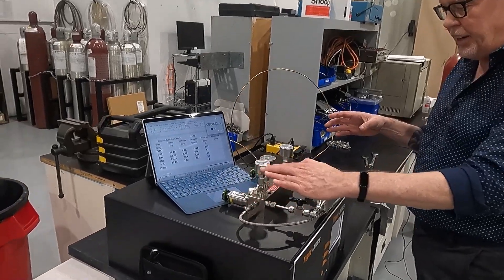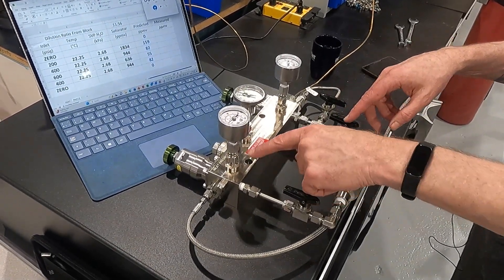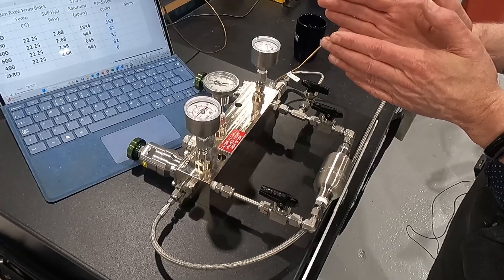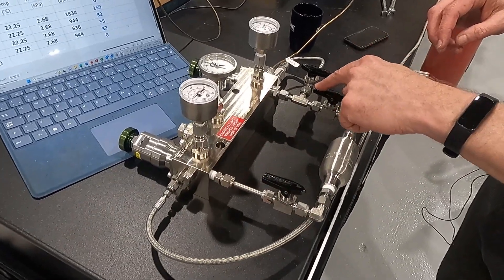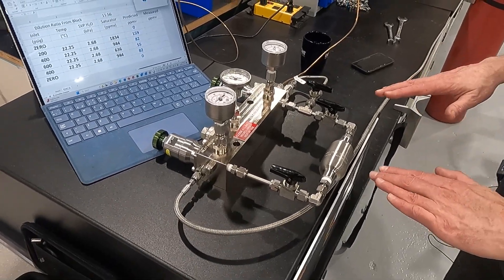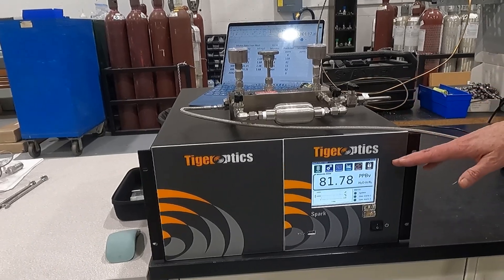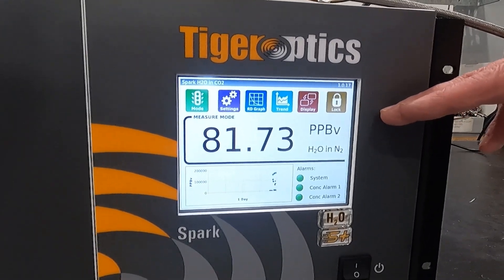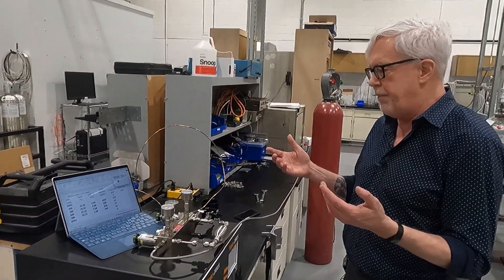We bring high pressure gas in. It splits up inside the block where part of the flow goes through a desiccant dryer. The other part goes internally where there's a moisture saturator, and there's a fixed dilution ratio between the two sides. Right now we're running only through the dryer side, bringing this gas down to a moisture analyzer. In this case we're using the Tiger Optics cavity ring-down spectrometer, and as you can see, running through the dryer it is currently reading about 81 parts per billion. This allows us to provide a reliable zero point for your moisture analyzer.